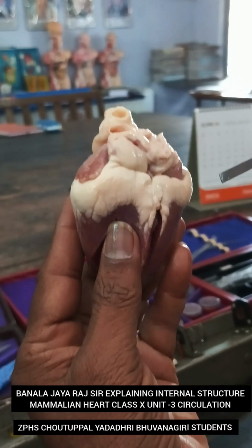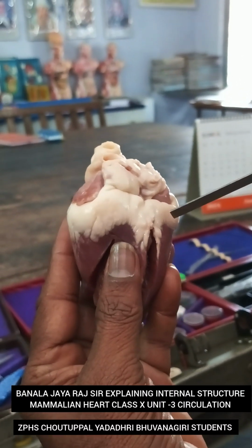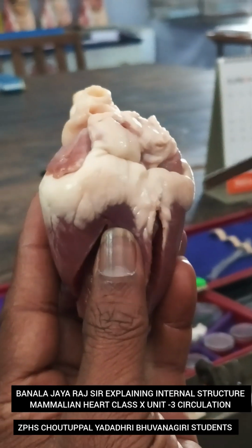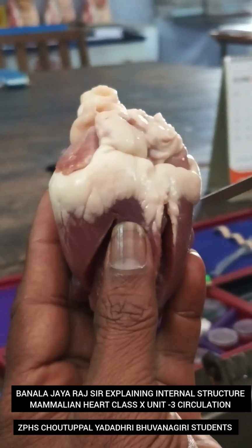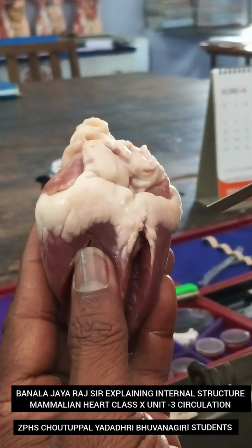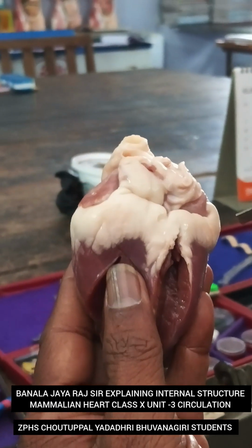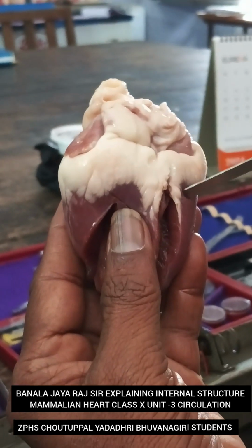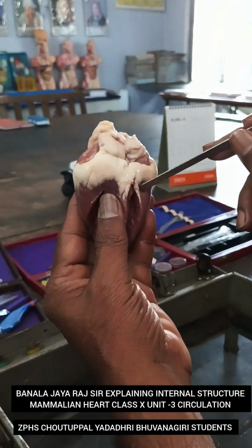Hello children, today we are discussing the internal structure of the heart, the mammalian heart. This is a goat heart, and this heart was given to us by Shailaja. So today we are observing the mammalian heart, or goat heart.